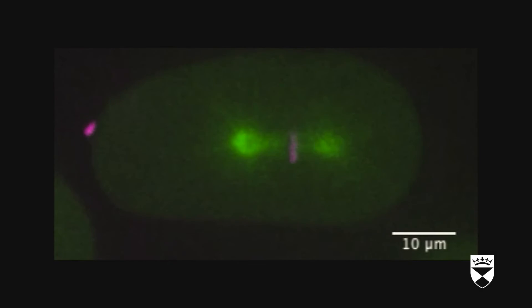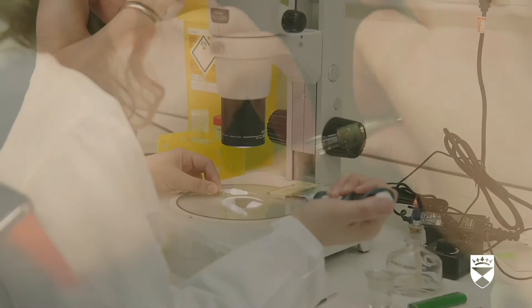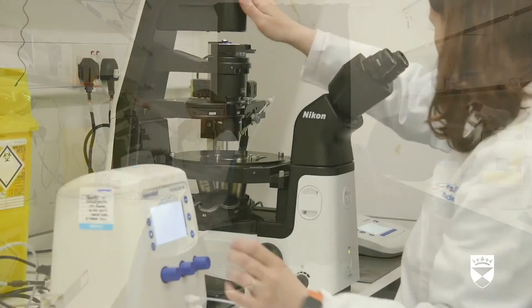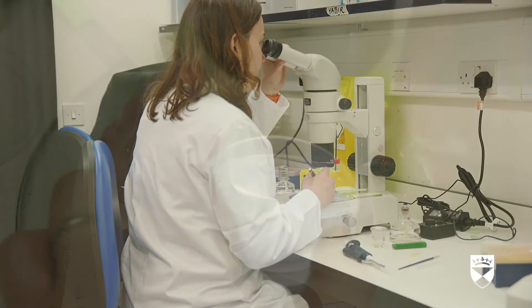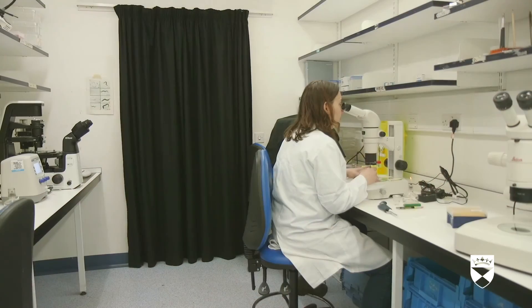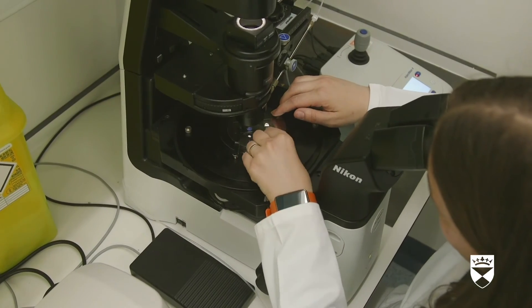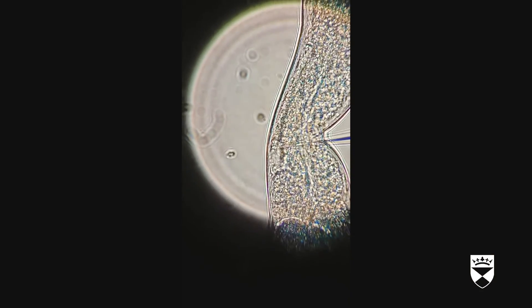The first scientist works with two microscopes and prepares a slide. Using the second microscope, she injects a worm, and footage shows the moment of injection. To help us further, we can get rid of any given protein or make alterations to the worm DNA and see what changes in meiosis. This allows us to identify key factors involved in gamete formation. We do this by injecting worms with a mix of components that can make these changes, using a special microscope equipped with an injection setup. We used this method in our recent work to show that a protein called PP2A is essential for several steps to guarantee that meiosis happens correctly.